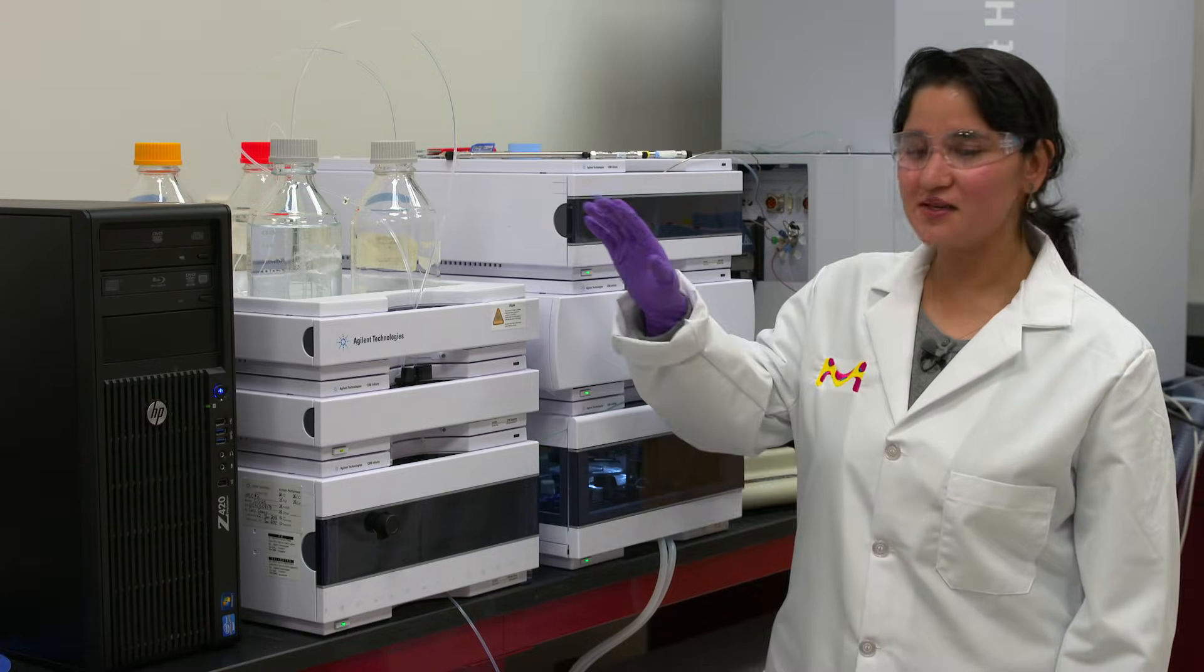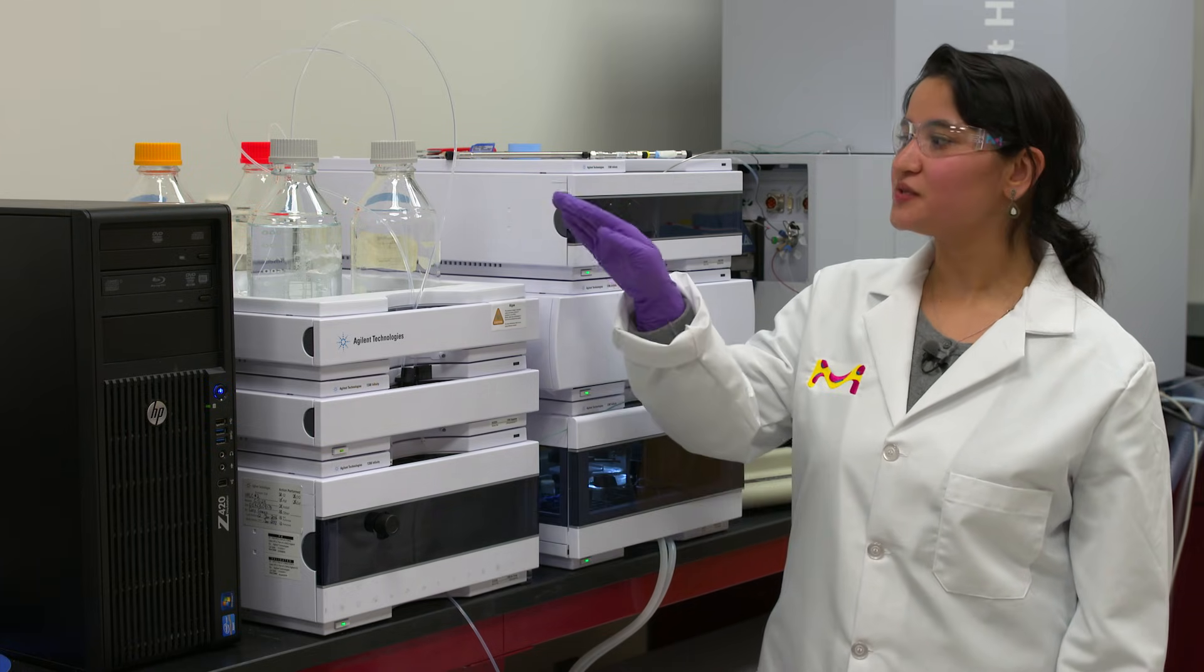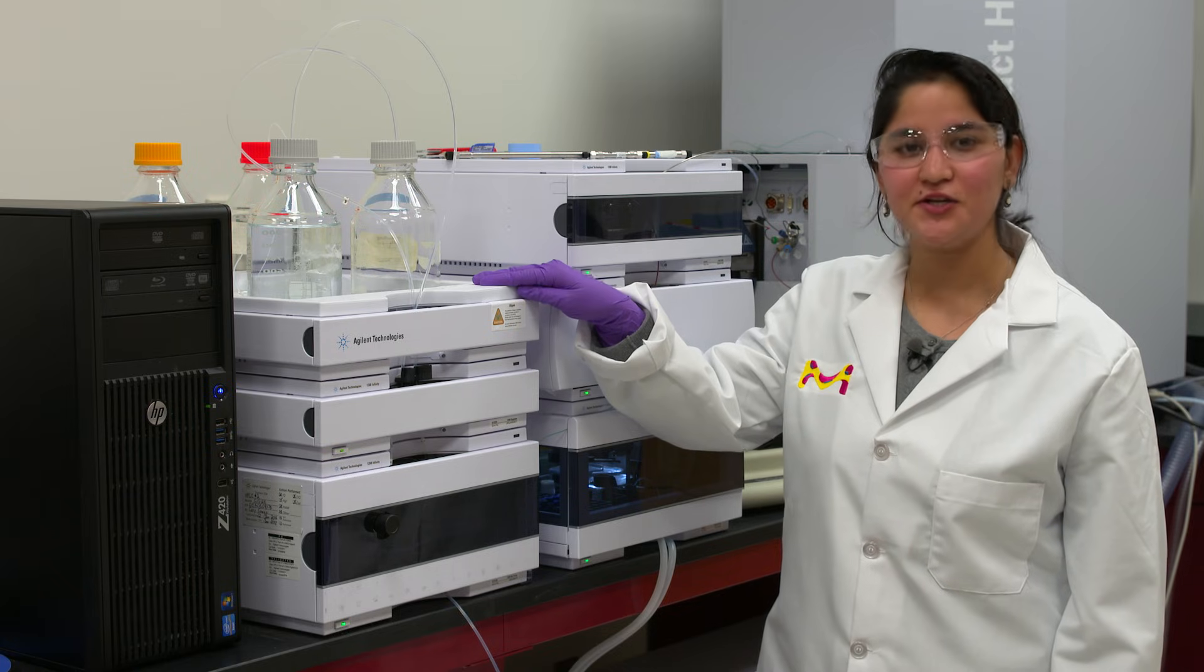Once your system is adequately primed, your column is in place, you have chosen the proper mobile phases, your system is ready to be equilibrated.